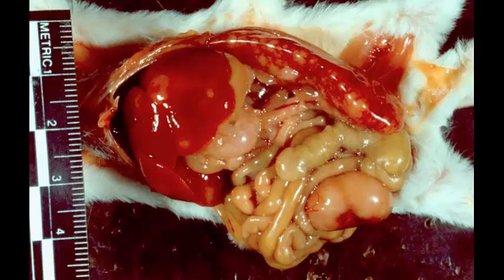Okay, this one shouldn't take you so long because, as I always say, if you see a big liver and a big spleen in a mouse, just go with lymphoma and you would be perfectly fine. This one also has a big lymph node as well. The only other thing that I would possibly entertain might be histiocytic sarcoma. Maybe that's 5% or less of these, but a big spleen, big liver, even if we didn't have the big mesenteric lymph node, you can't go wrong with lymphoma.